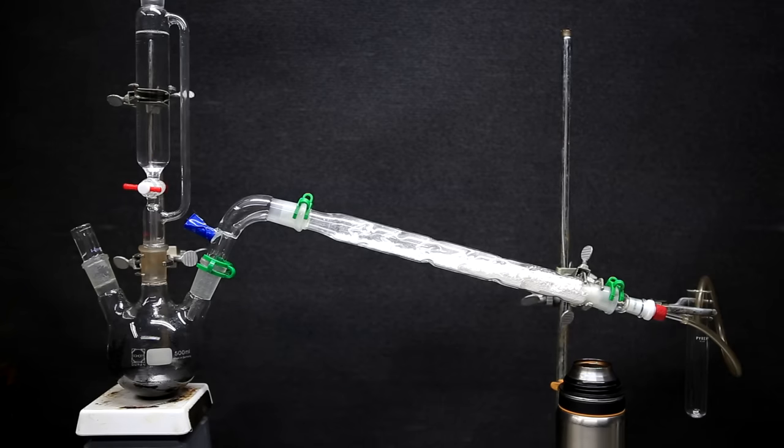The oxygen is now dry and it passes through a little bit of hosing which leads into a test tube. This test tube will be put into some liquid nitrogen so the oxygen condenses.